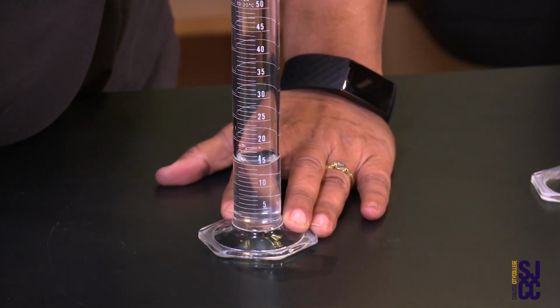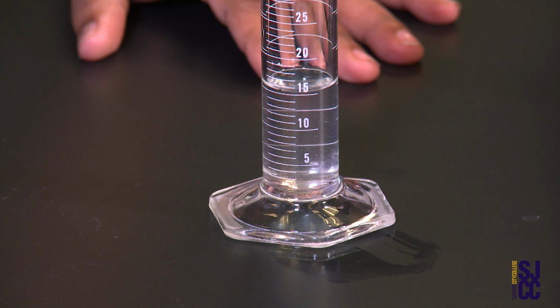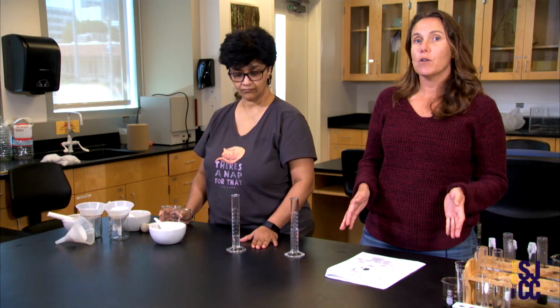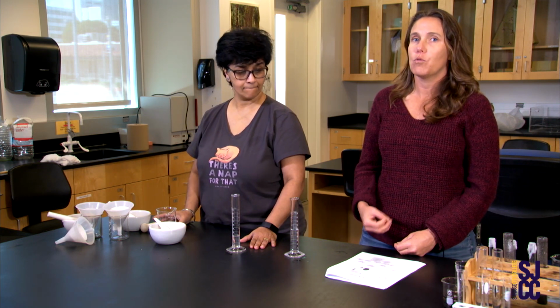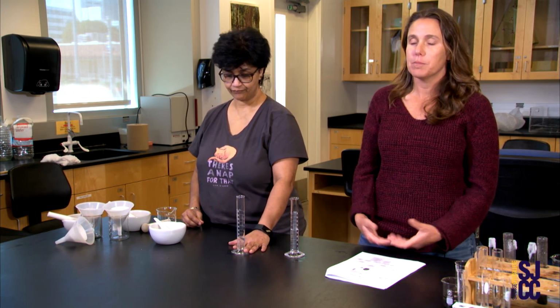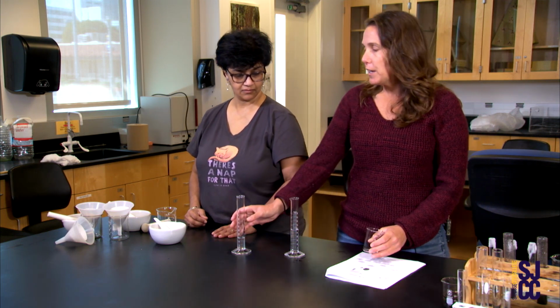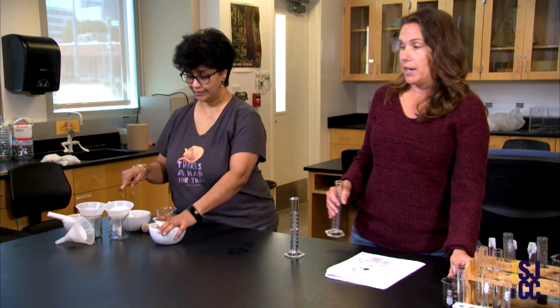So that is 16, out of the 30. Yep. So 16 out of the 30 was able to leach out, thus sand only retained 14 milliliters of water. So the water holding capacity was only 14 milliliters. So that's not a huge amount, but it did retain some of that. Yeah, about half of it.